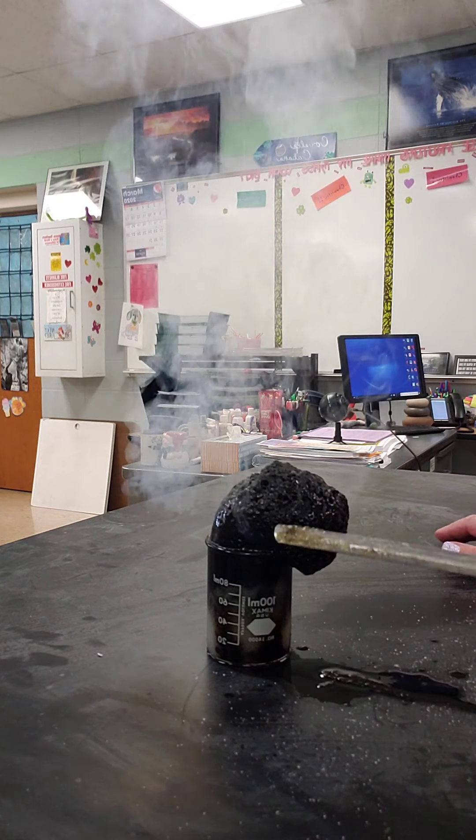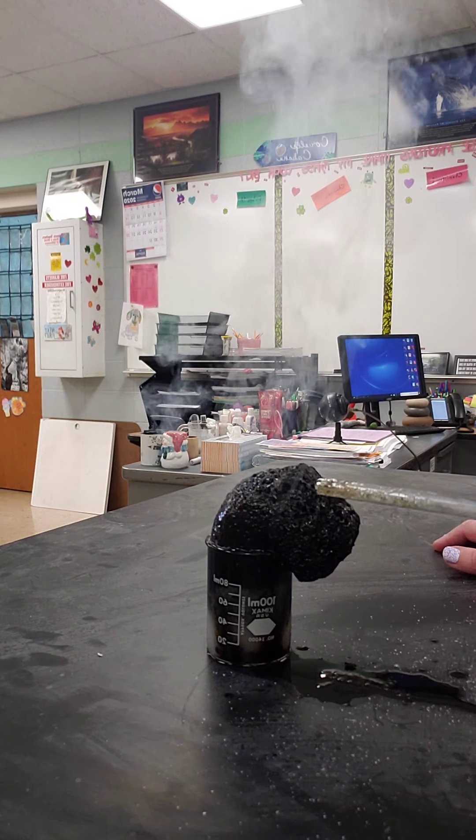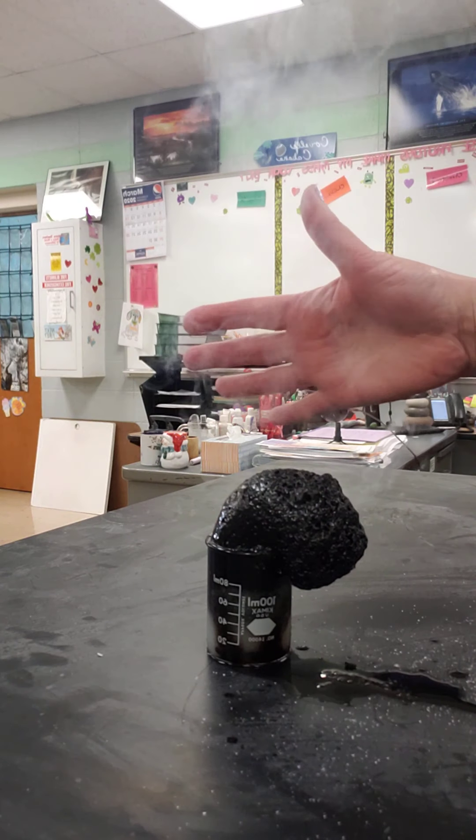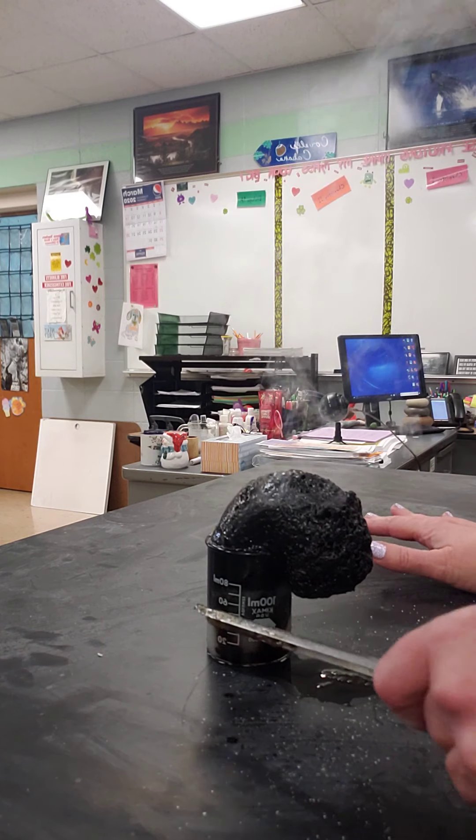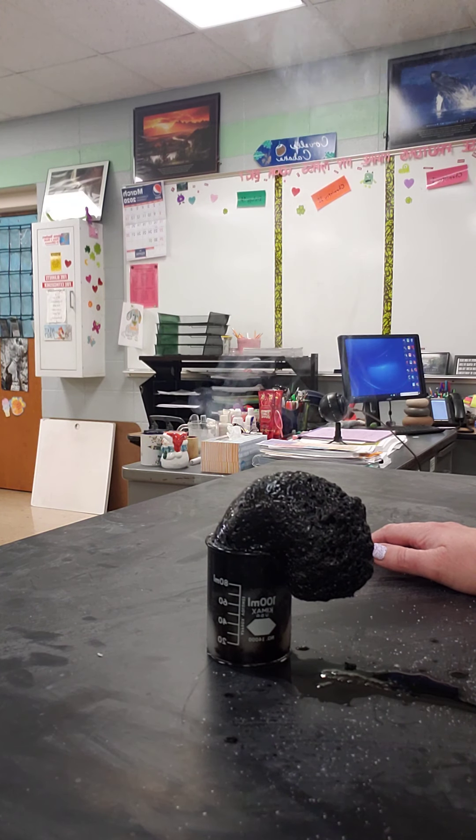And this is pure carbon. And it's so hot, giving off water vapor too. That's really hot. So there's your energy. See how much energy is stored in that sugar?